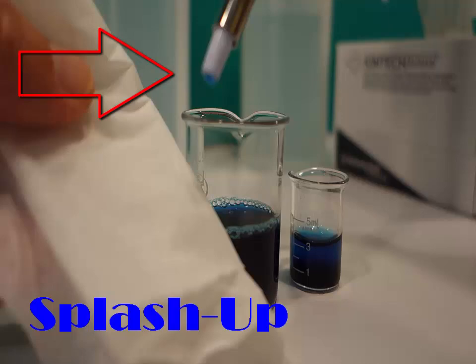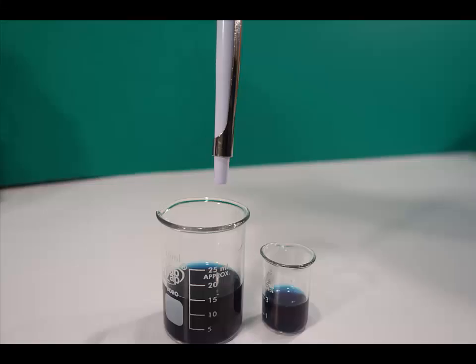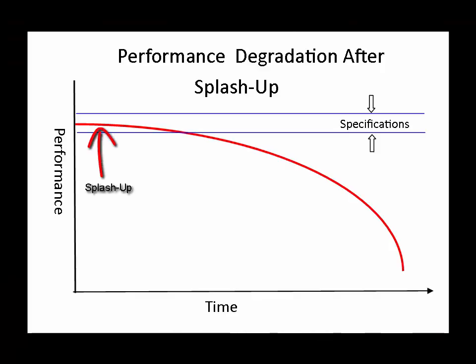First, your pipette will go out of calibration. Because there is very little dead space inside the barrel, the liquid touches the piston and coats it. The liquid dries and/or mixes with the piston grease and the performance slowly deteriorates.